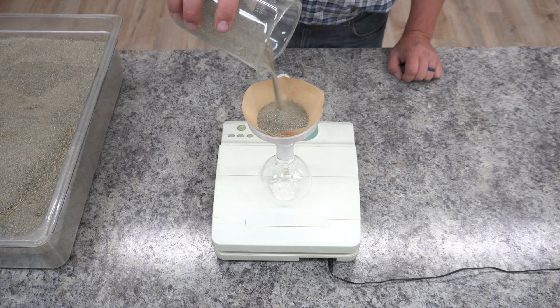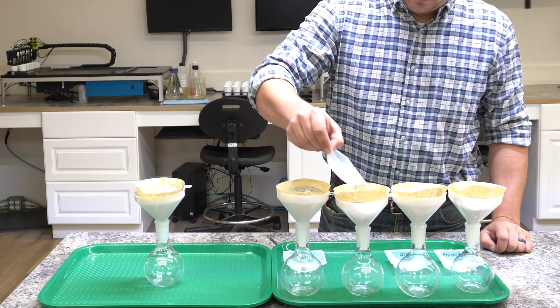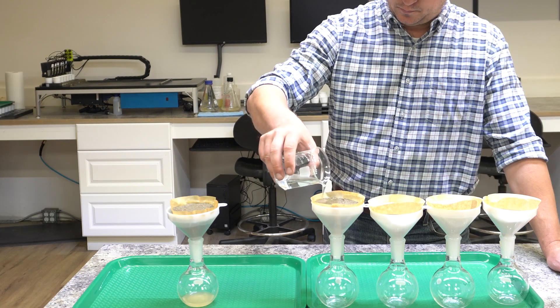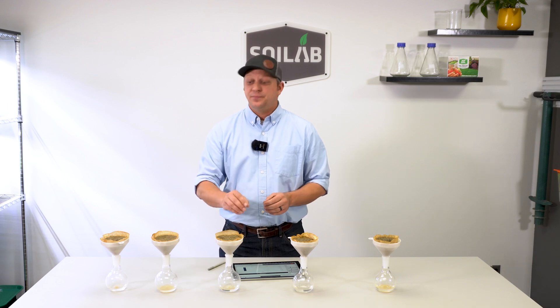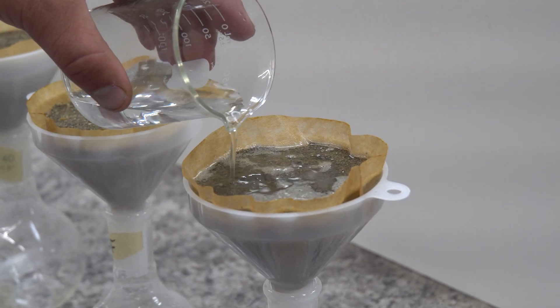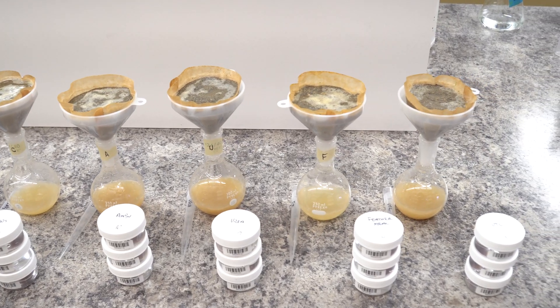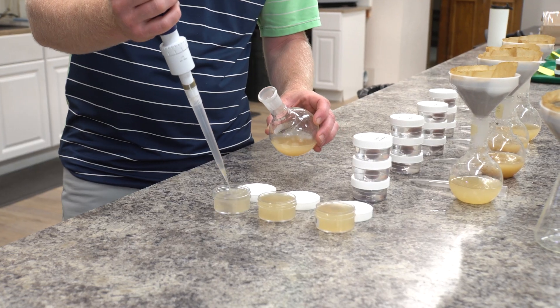As we set this study up, we added 300 grams of sand to each of these filter cups. We used this sand because it's going to have a relatively low baseline nutrient level — it's going to really remove variables so that we can look at the effects of our additions. We used both organic and non-organic fertilizers: feather meal, urea, ammonium sulfate, and calcium nitrate. Those were all applied at the equivalent rate of one pound of nitrogen per thousand square feet. Following that surface application, we leached with 150 mils of water, grabbed three samples of leachate from each, and analyzed it using the MySoil ion exchange resin capsules.